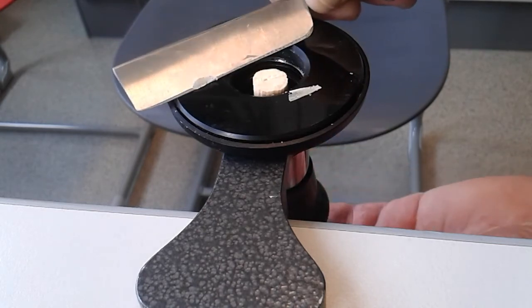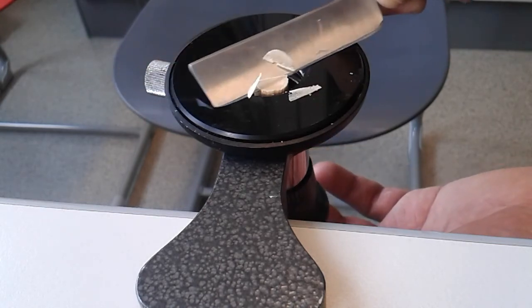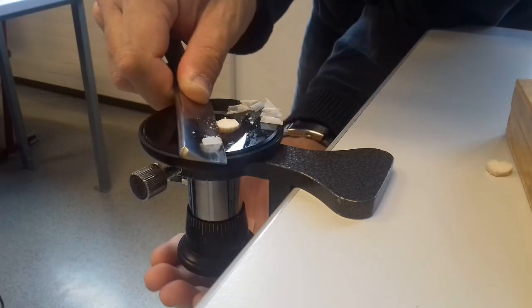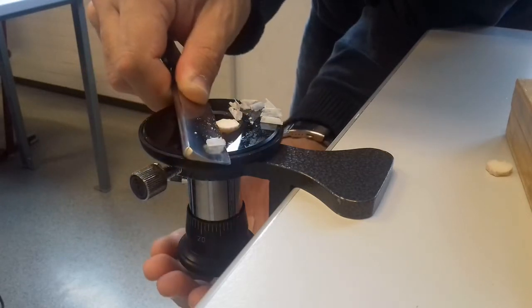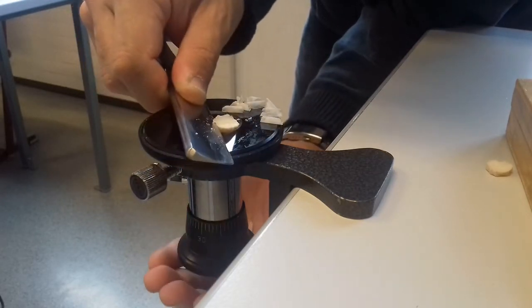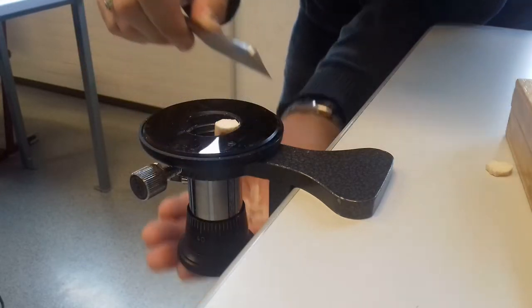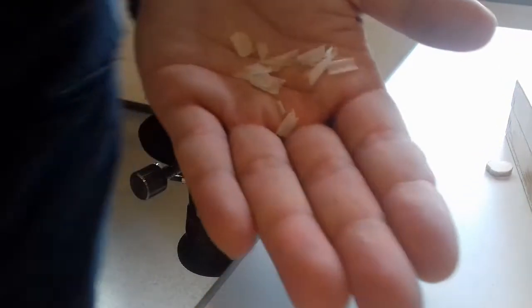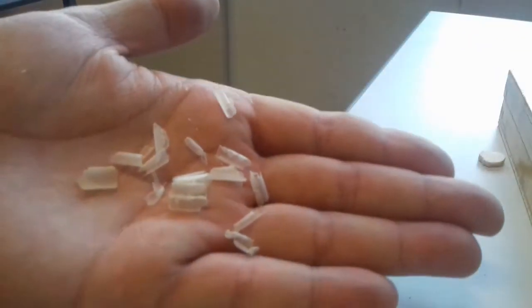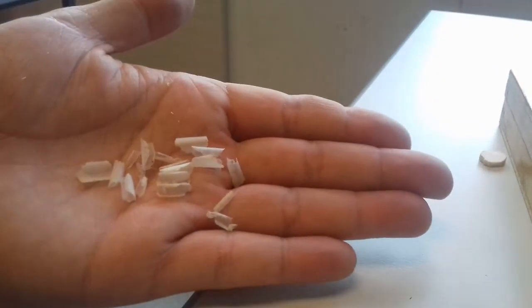I will see if this works. I will turn it again. I have also made another video in which I use a carrot instead of the elder pith. So I hope that you get the idea.